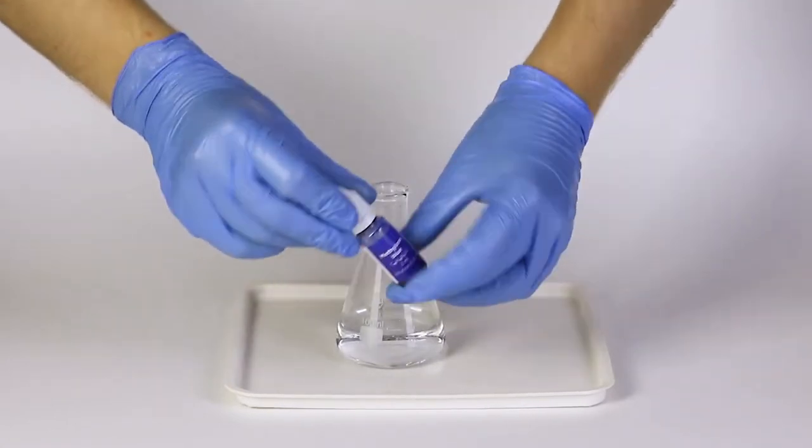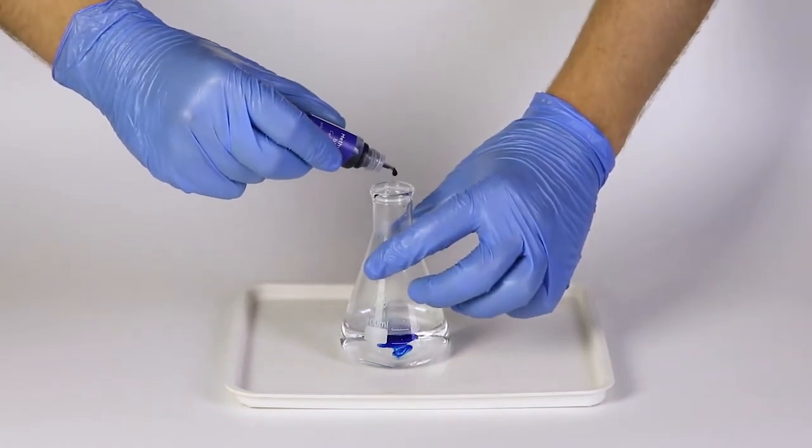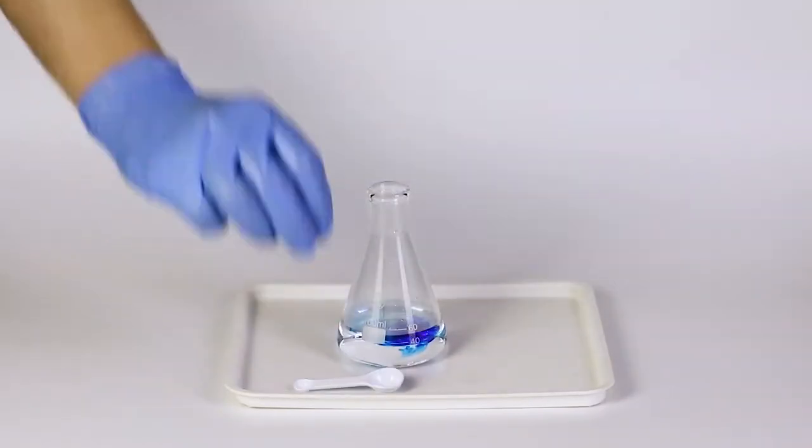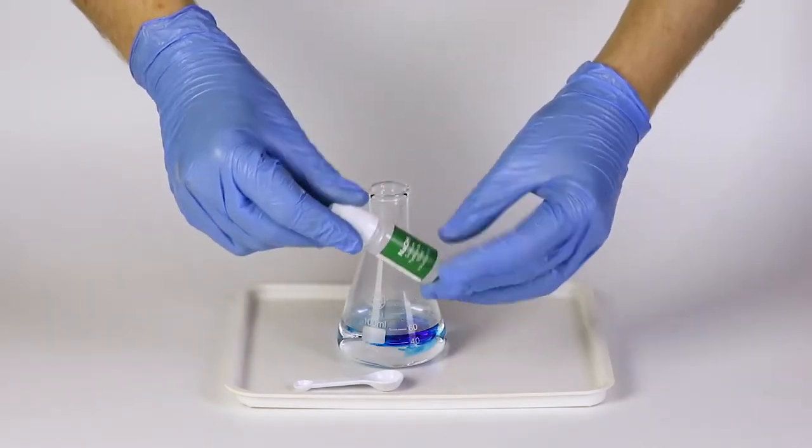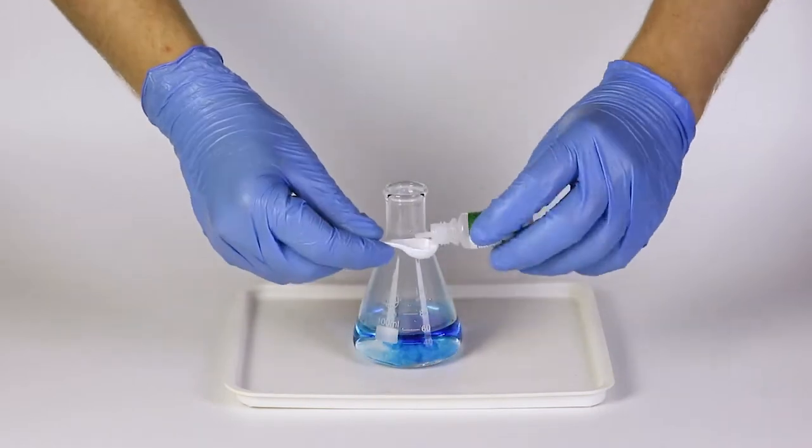Next, add five drops of methylene blue. Finally, add three big spoonfuls of the sodium hydroxide solution to the flask.